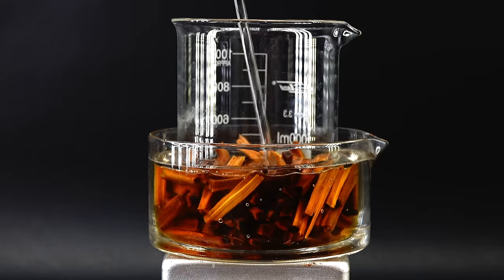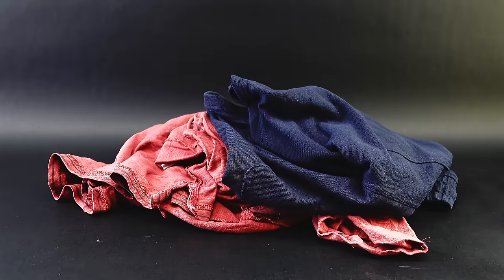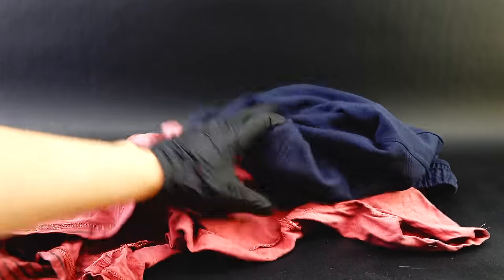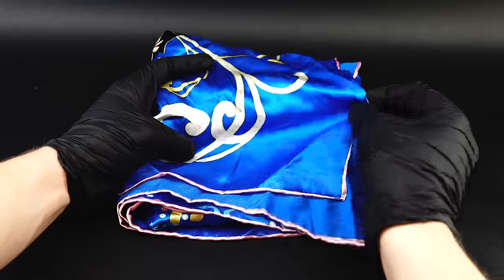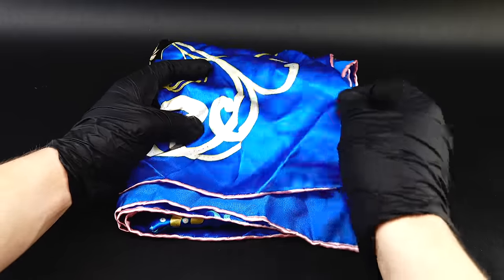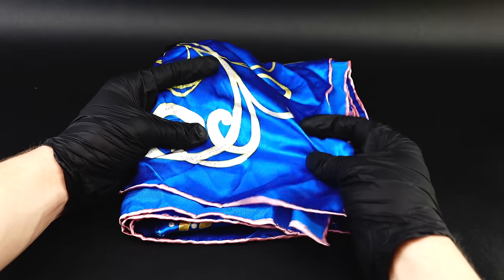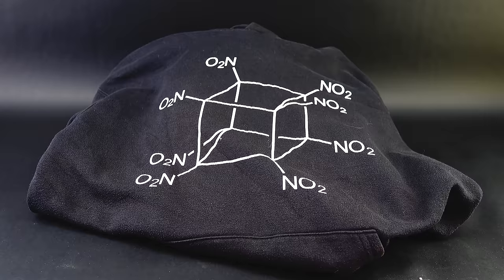Hi guys, welcome to Amateur Chemistry. We all know that the clothes we wear are made out of various fabrics, with the most common ones being composed of things like cotton, nylon, or polyester. I recently became really interested in the chemistry of such everyday items, and decided that I want to make my own fabric to use in making some cool chemistry themed clothing.